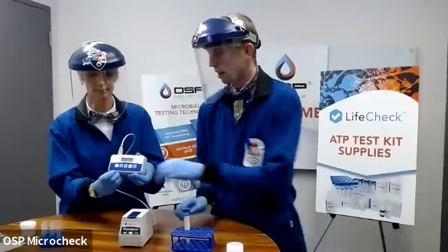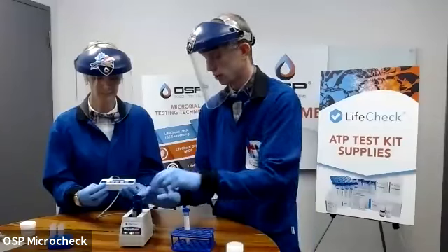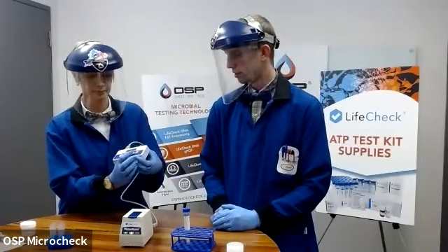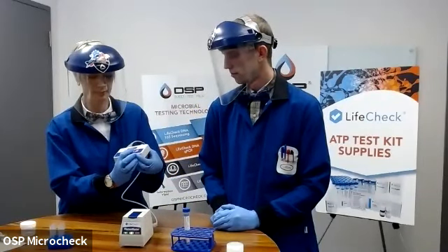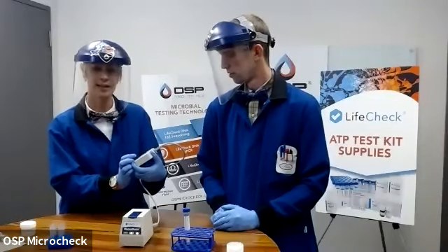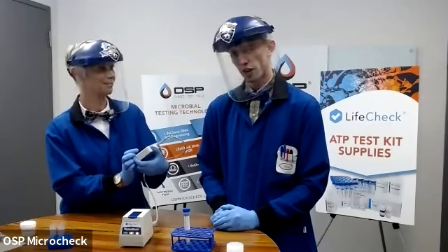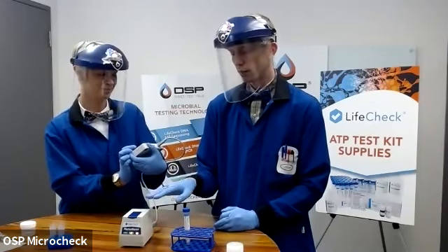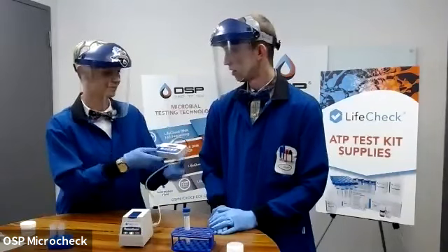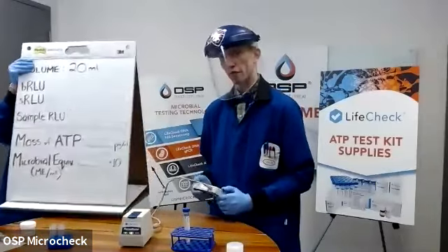In the meantime, I'm going to place a blank or empty assay tube into our instrument. Once it turns on there, Virginia, if you want to hit the green button to the point where it takes a reading. That was 3 pushes. And then it's going to count down for 10 seconds. And we'll record this value as it comes out of the instrument. In our spreadsheet, this is referred to as the BRLU or background RLU. I'll let you hang on to that. All right. And we have a BRLU value of 5.